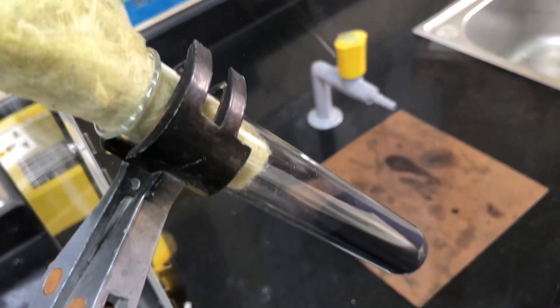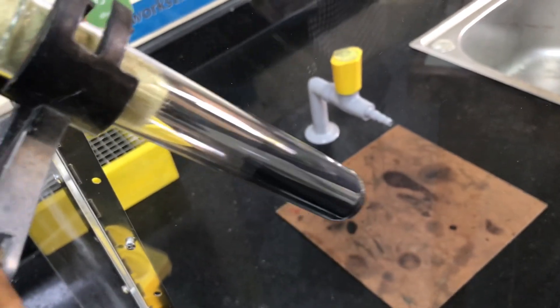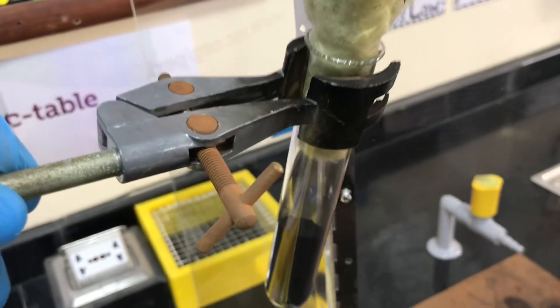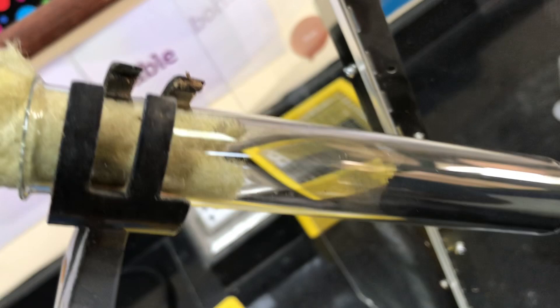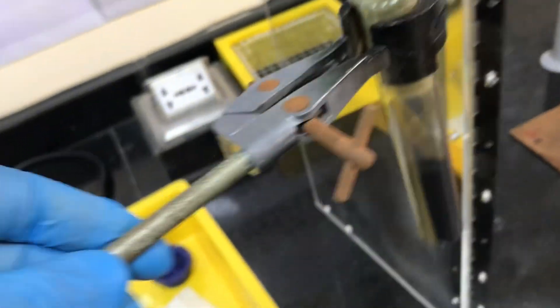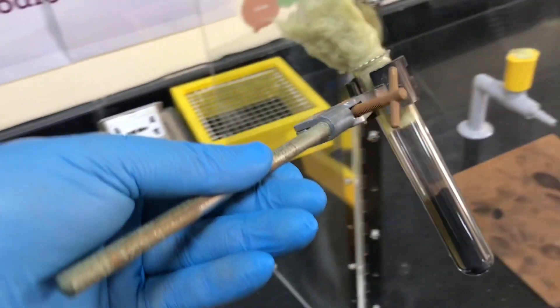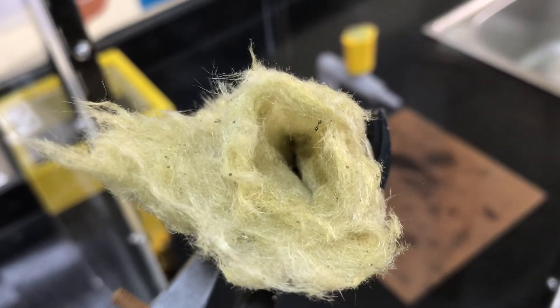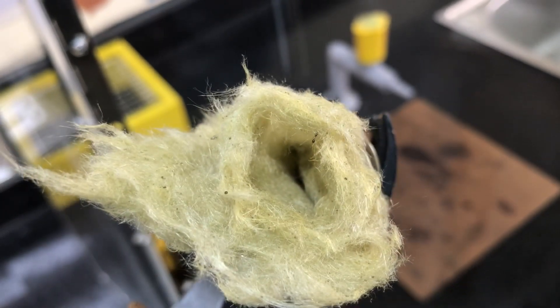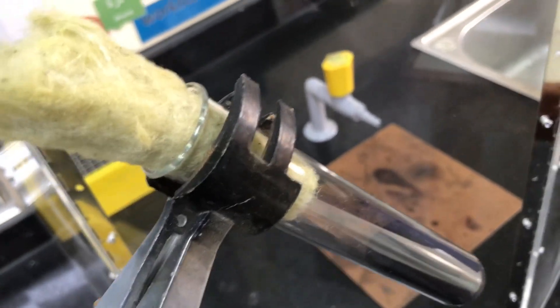So if you do want to shake it first of all rest the bottom of the boiling tube on the mat so you'll give you a little bit of a surface to move the boiling tube and just use the end of a clamp. Just make sure that the end of clamp actually has a cork not rubber. Obviously don't have the rest of the clamp connected to it. You can actually see over here that I folded the mineral wool and there is a little bit of a gap on the inside to relieve the pressure and we're going to heat this now.